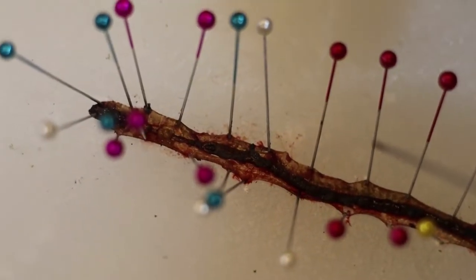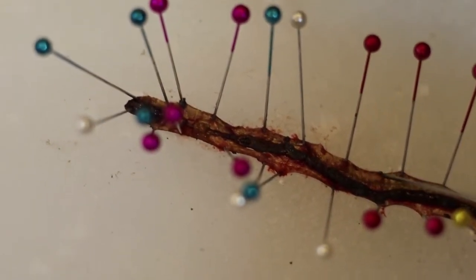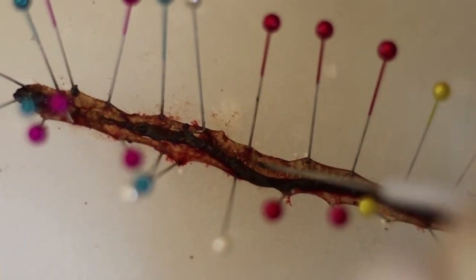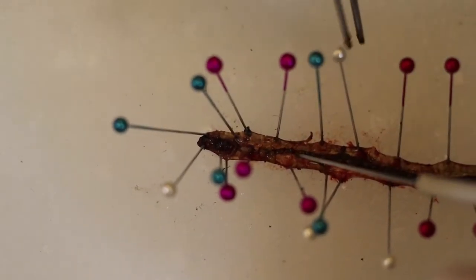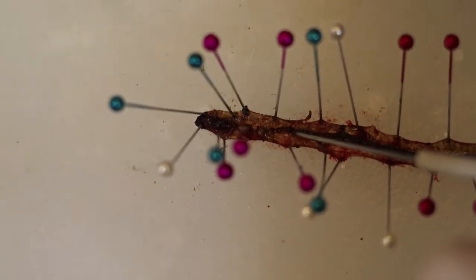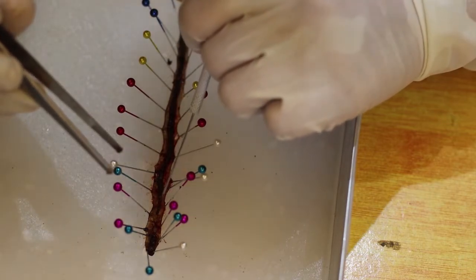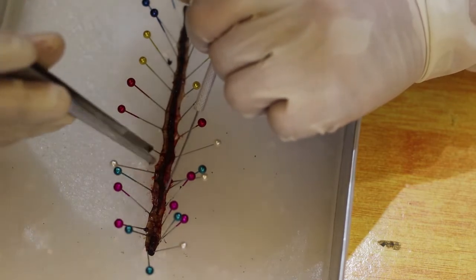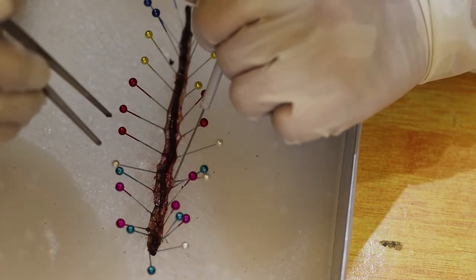And the ventral blood vessel runs longitudinal to the intestine. The white part right here beneath the intestine. So the ventral nerve cord is longitudinal and it is located on the ventral side of the intestine. So the thin walled part right here is what? A soft thin walled part is what you call the crop. And the hard, muscular part, you can feel the hard and muscular part, is what you call the gizzard.